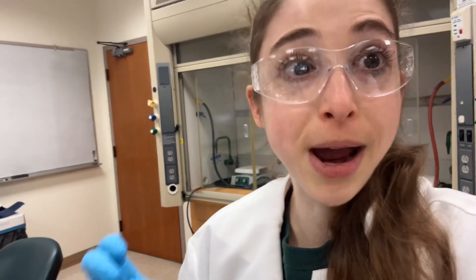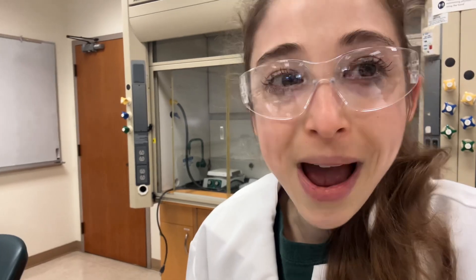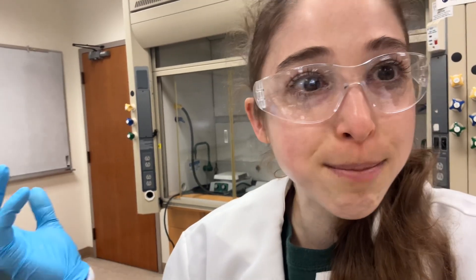These bacteria have huge bioremediation potential, and we're trying to figure out what's happening inside them as they do this. How is their metabolism adapting? We're going to measure the organic acids, measure the metabolites, measure the enzymes — looking at how active the different enzymes of the tricarboxylic acid pathway are, both in vivo and in vitro conditions. We're expressing and purifying malate dehydrogenase from these bacteria, and we're going to do some genome sequencing.